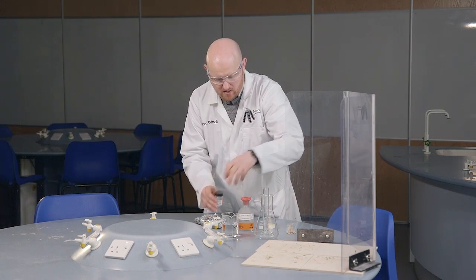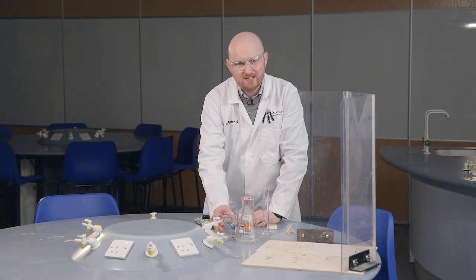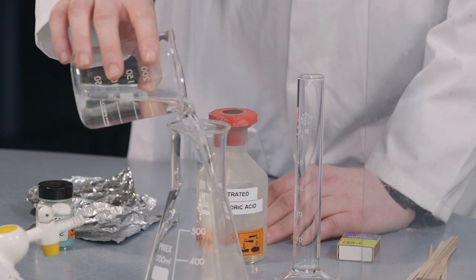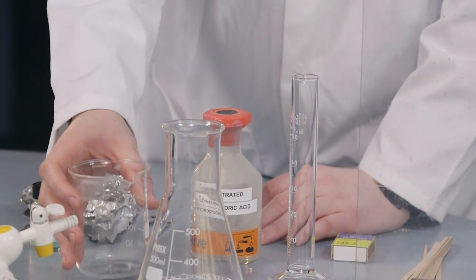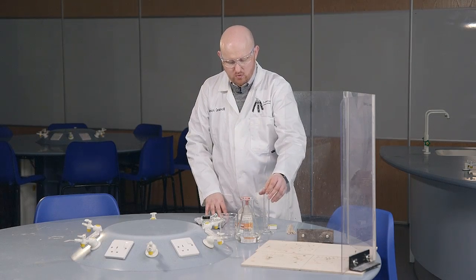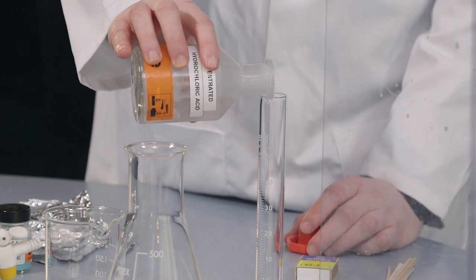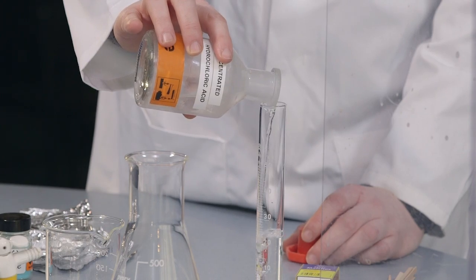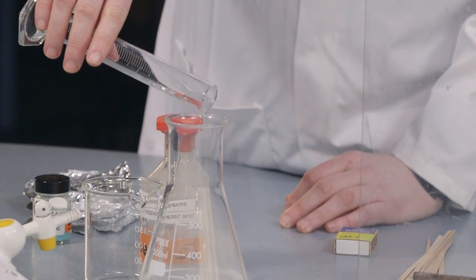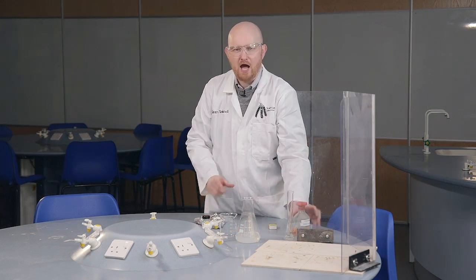We're going to take our conical flask and add 200 mils of distilled water, like so. Then we're going to take our hydrochloric acid and add 20 mils of concentrated hydrochloric acid into our water and pour that in — always remembering to add acid to water.